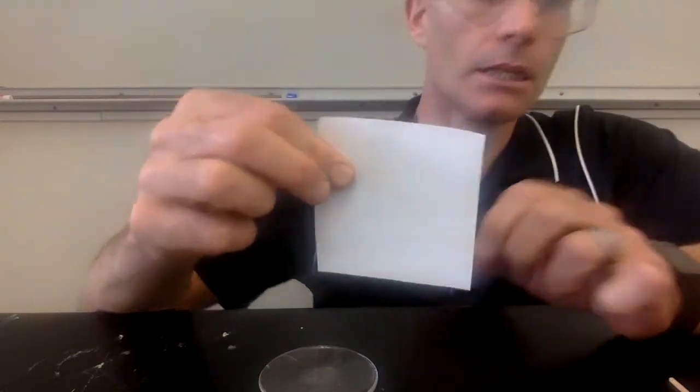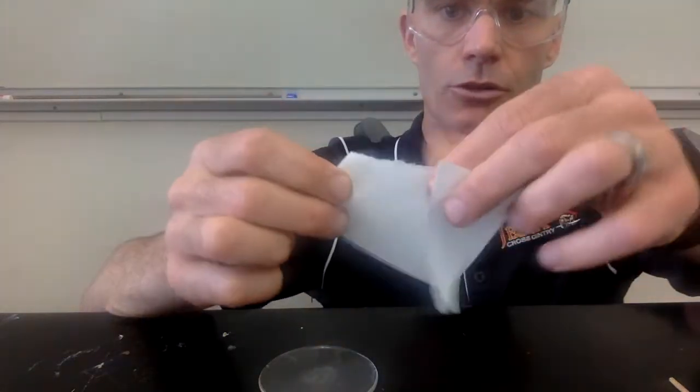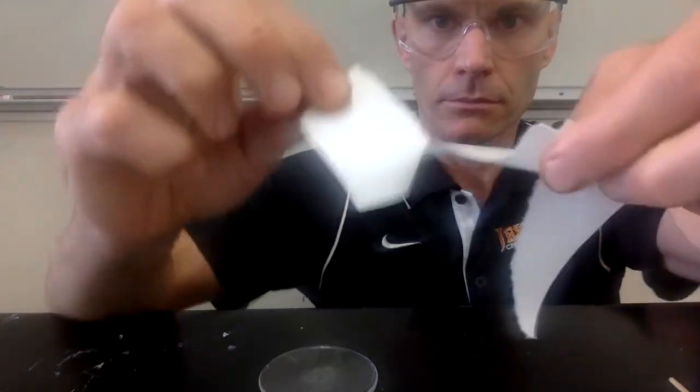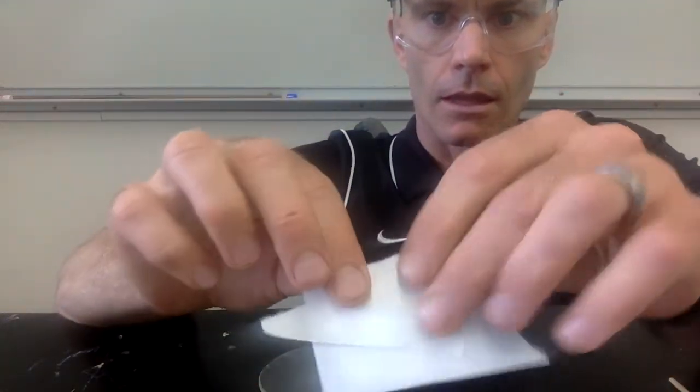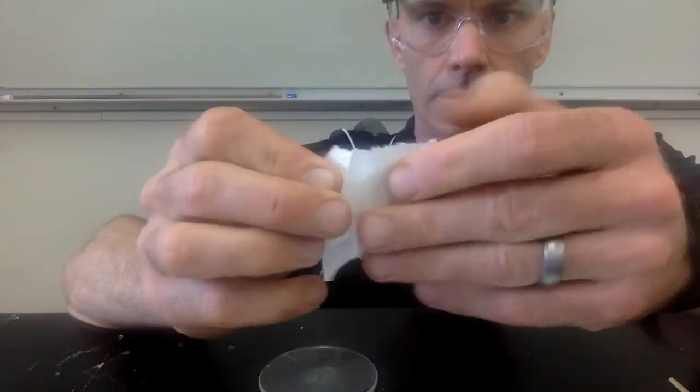All right, this video is going to help you complete the Exploring Properties of Matter lab. We'll start with investigation number 1. So in investigation number 1, we're just going to take a piece of paper and we're going to tear it into pieces. And as I'm doing this, you should be recording your observations in your data table.